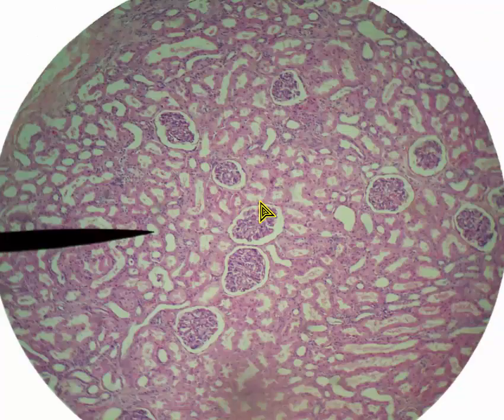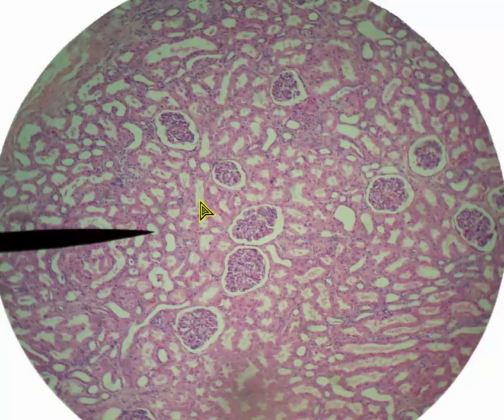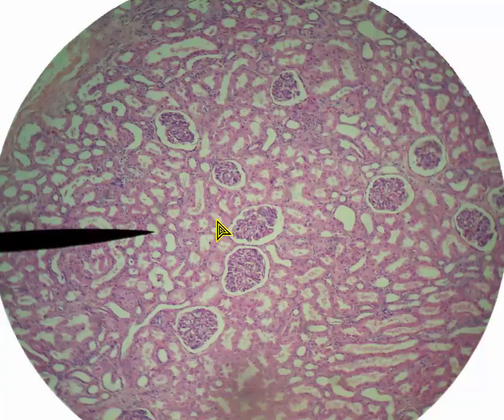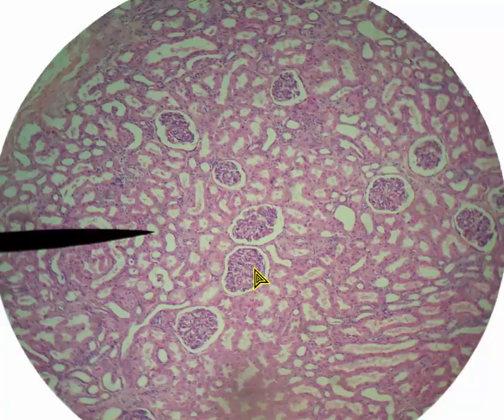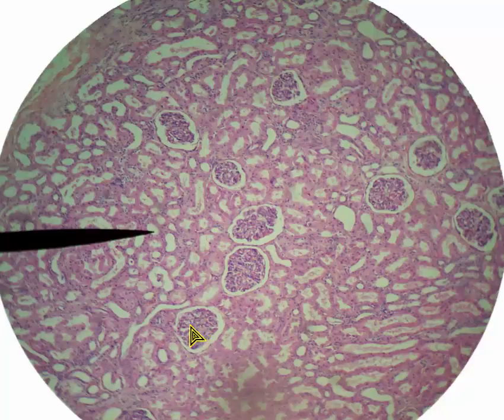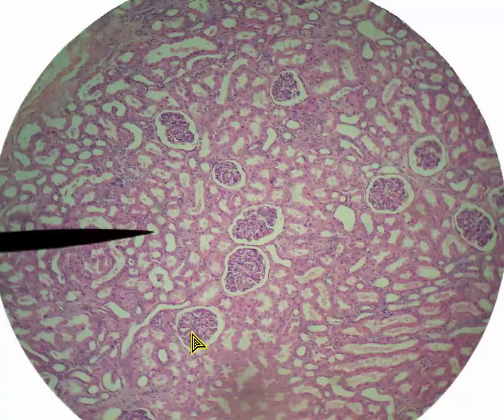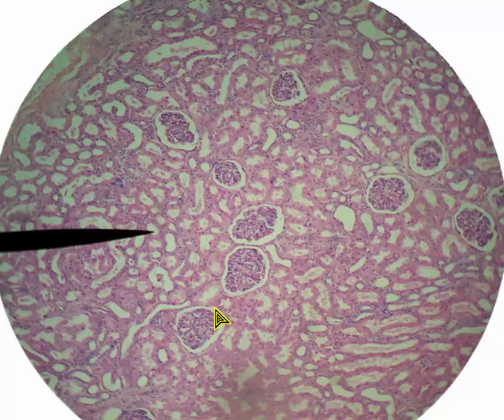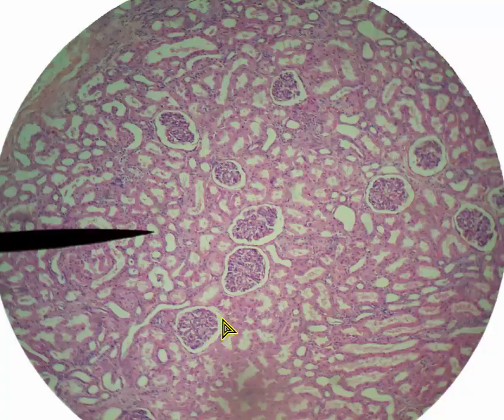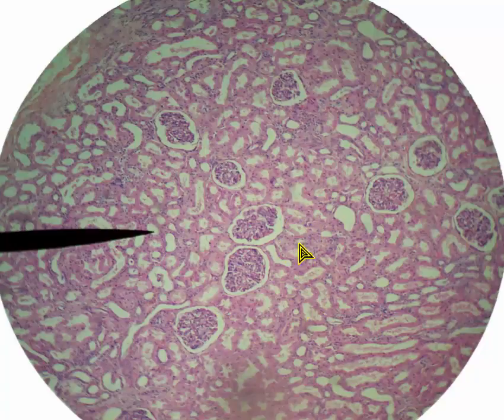Moving on to 100 times magnification. Now we can more clearly see the renal tubules and more closely see the renal corpuscles. We can start to see the parts of the renal corpuscle: glomerulus and glomerular capsule or Bowman's capsule. And that's about it at this magnification.